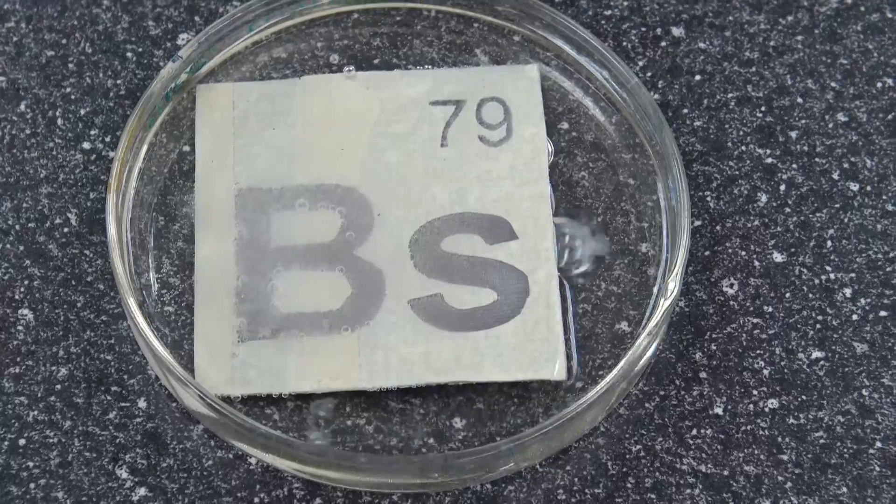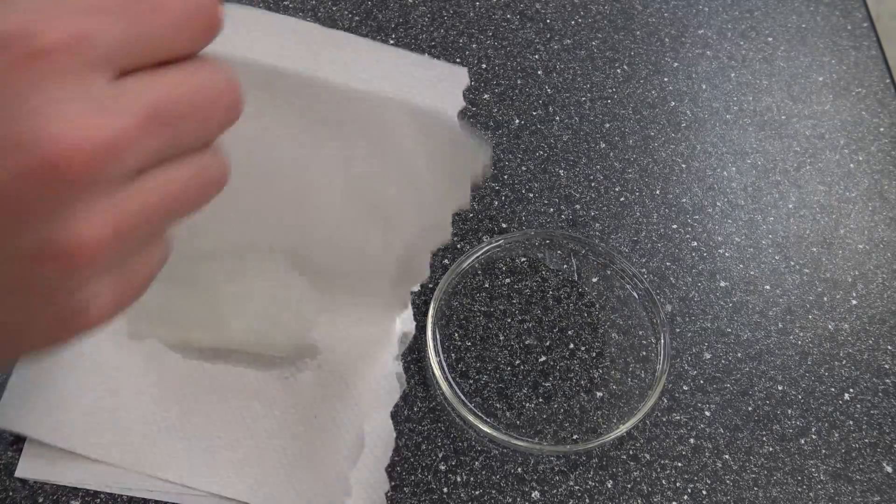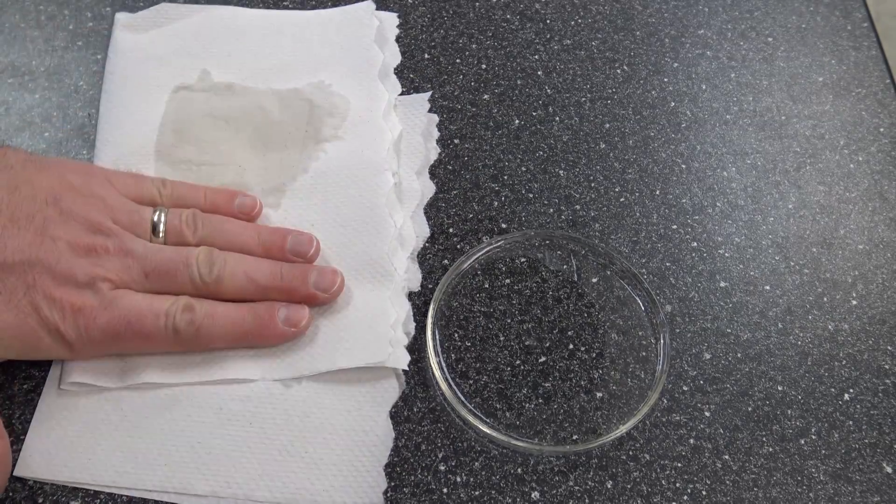Back to my ornament. I've got it sitting in the acid bath. You can see it bubbling away as the zinc dissolves in the hydrochloric acid.